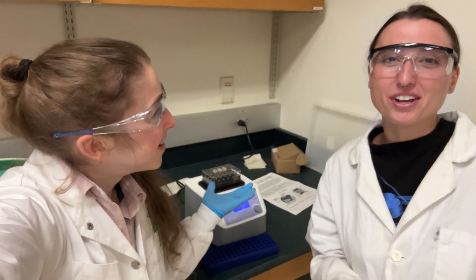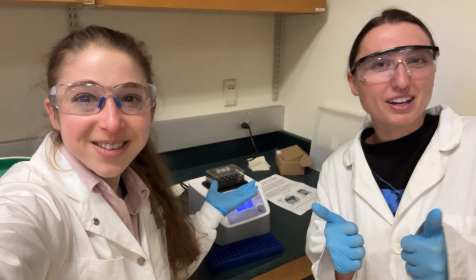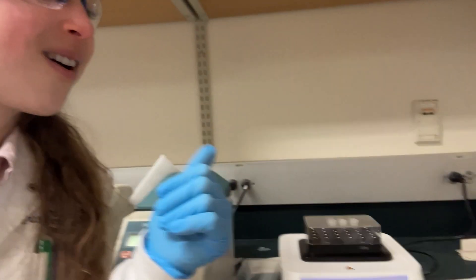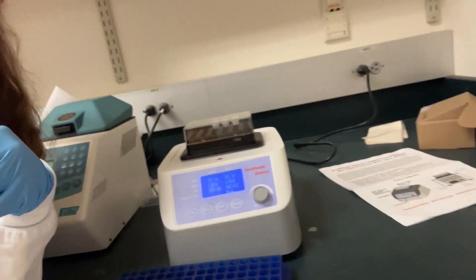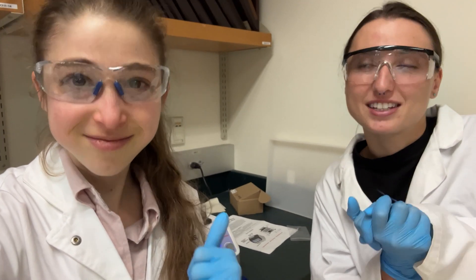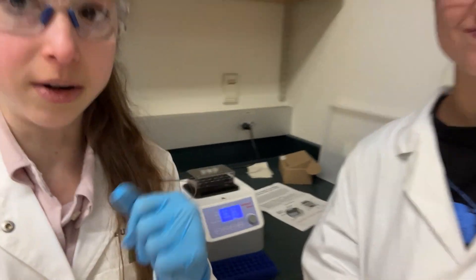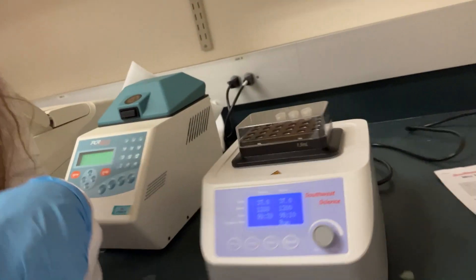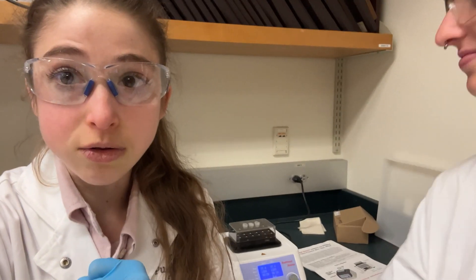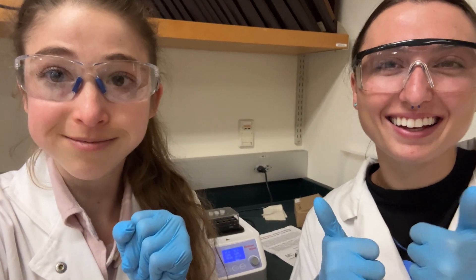Hayley confirms: we are methoximating and silylating our samples so we can derivatize them for the GC-MS. It's really important that we keep moisture out, so we have parafilm over the lids to try to keep out water.